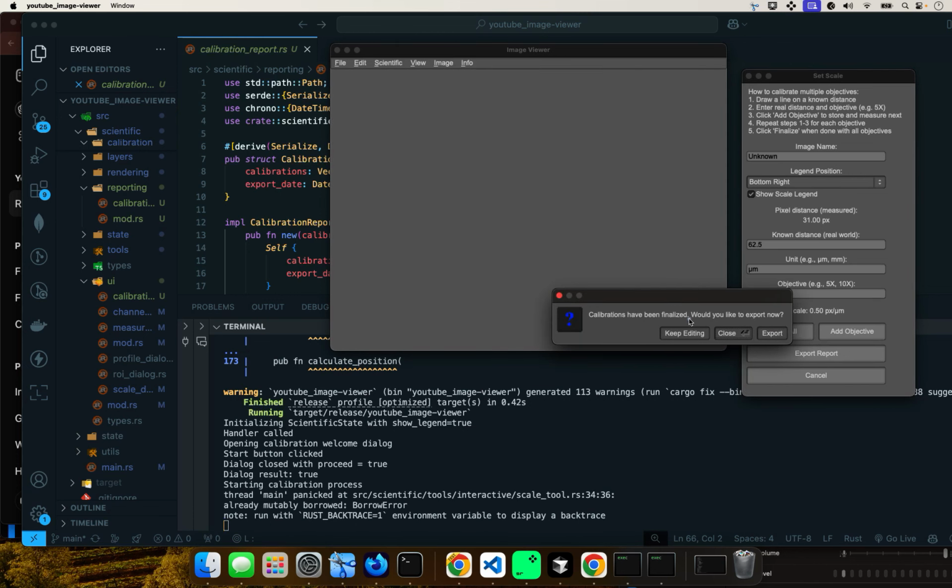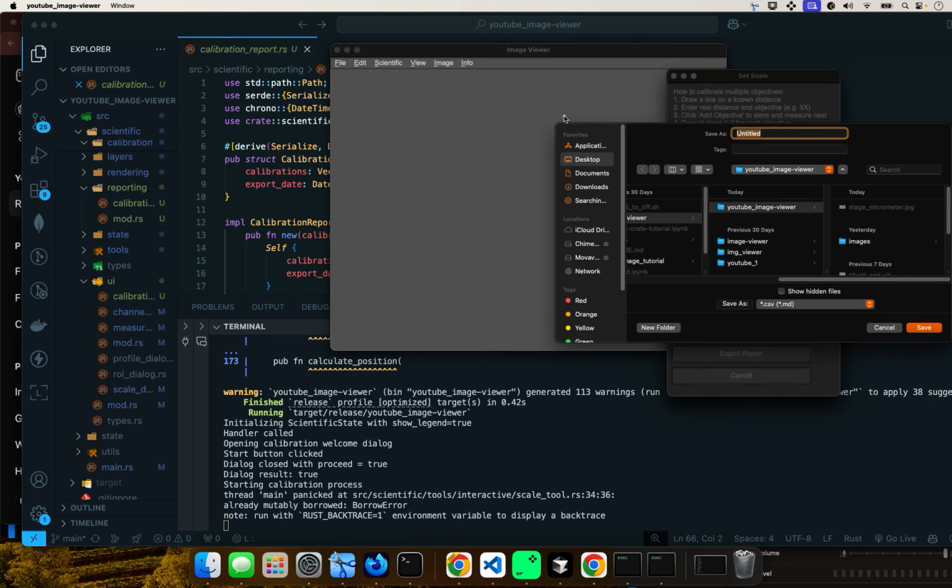It gives you a choice to keep editing, close, or export. I'm going to export. And now I go to export report. You name the report, let's call it hello YouTube. And it gives you a choice of a CSV file or a Markdown. Actually, you can put PDF.